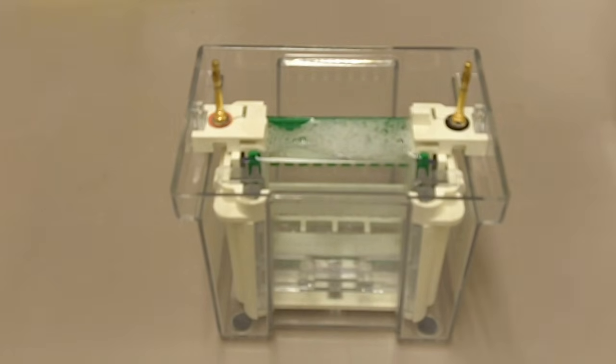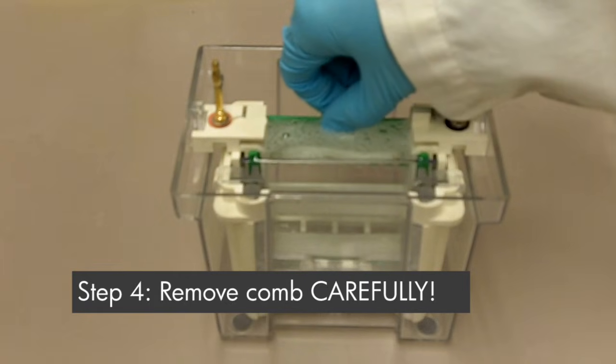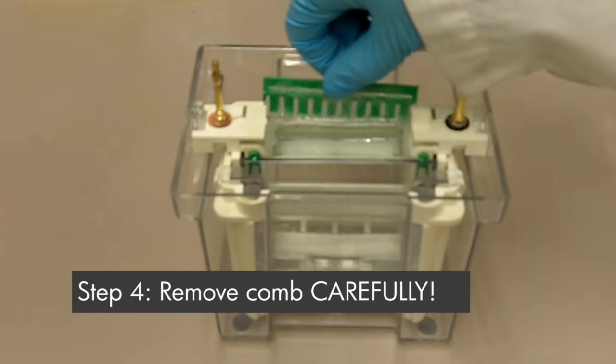After you fill the chamber with buffer, it is now easier to take out the comb because the comb is now lubricated. So make sure you take the comb out carefully because you don't want to break the well.